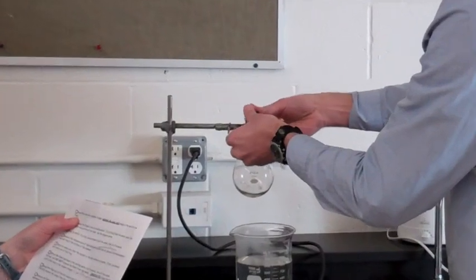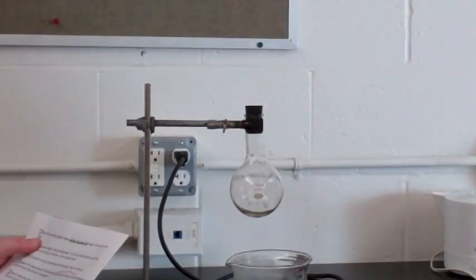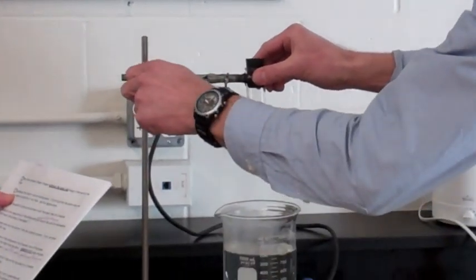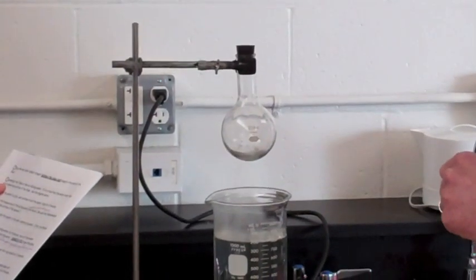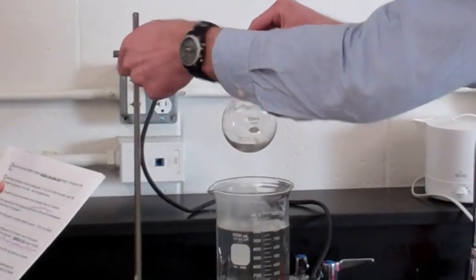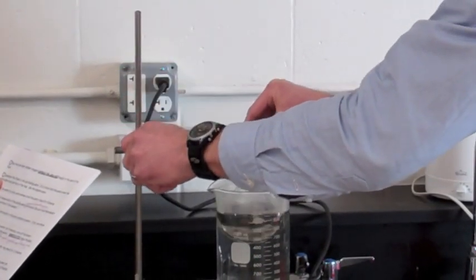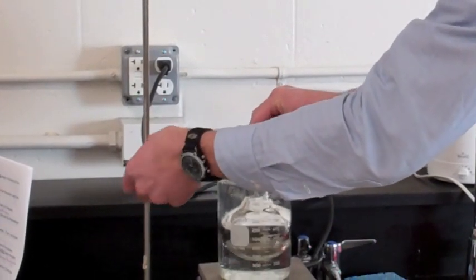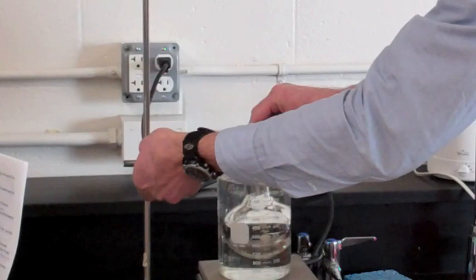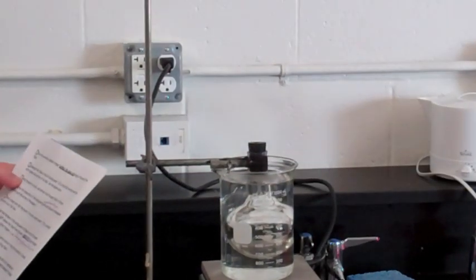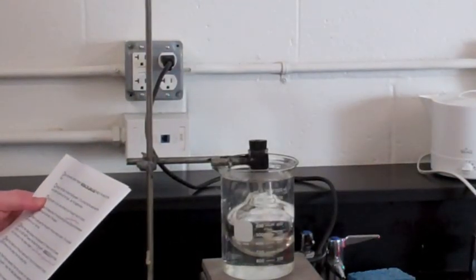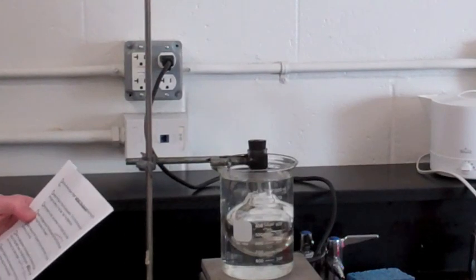Submerge the flask in the hot boiling water. It is critical that the water cover the entire spherical portion of the flask. And that we don't overflow the boiling water. Bring the water to a boil and continue to boil the empty flask for five minutes. We'll see you back in five minutes.